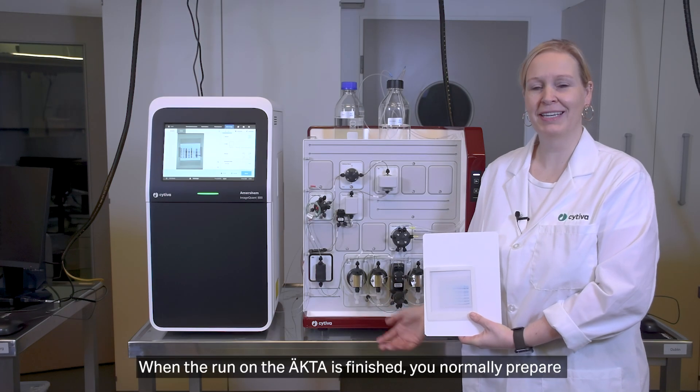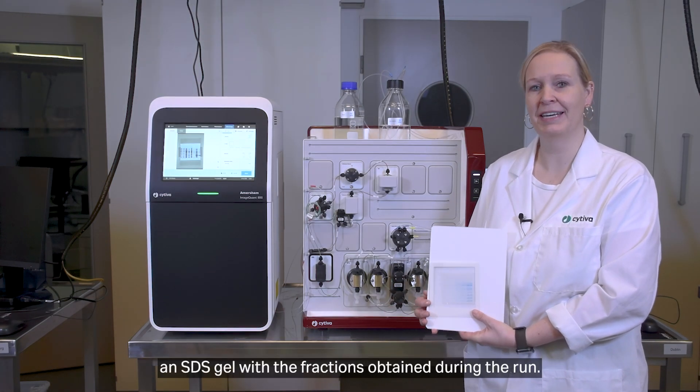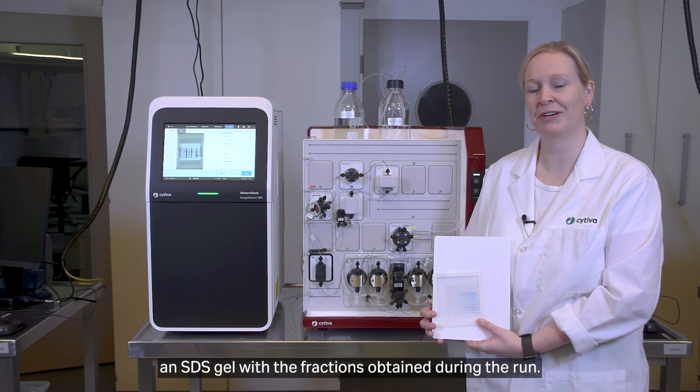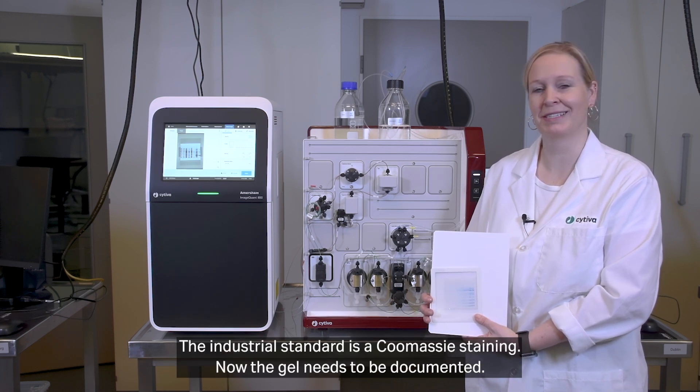When the run on the ÄKTA is finished, you normally prepare an SDS gel with the fractions obtained during the run. The industrial standard is a Coomassie staining.